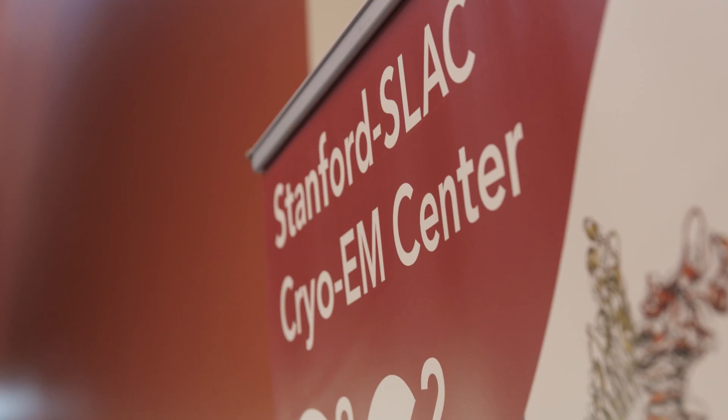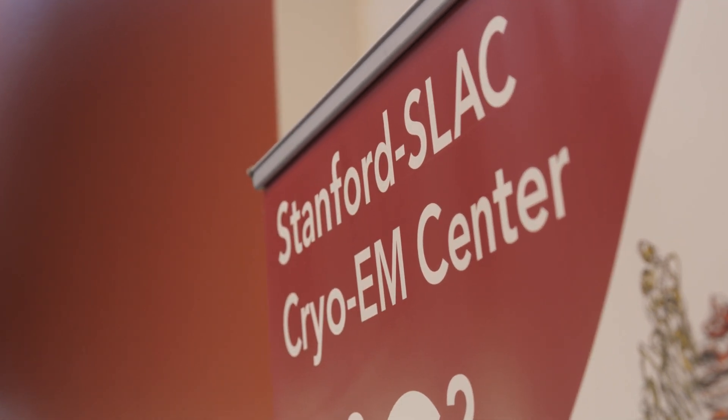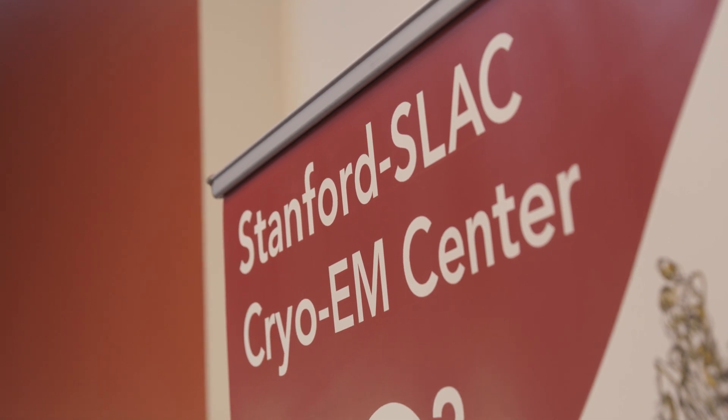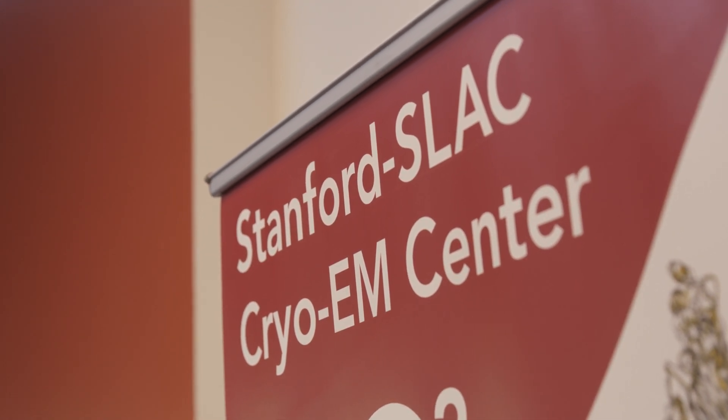I have trained graduate students and postdocs myself over many years, and it is really a joy to see how they grow and get on the path for their own science. Through the centers we have that capability, and it's part of our mission. There is so much that we can offer: instrumentation, methods, know-how, science — and we bring that to them in addition to what they also get at their home institution. I find it very inspiring — as a matter of fact, I find it awesome.